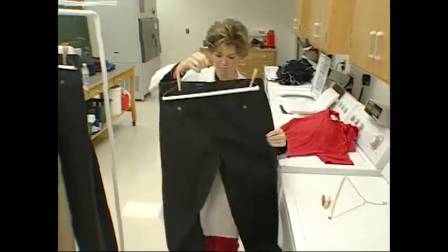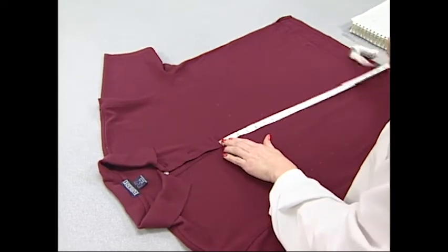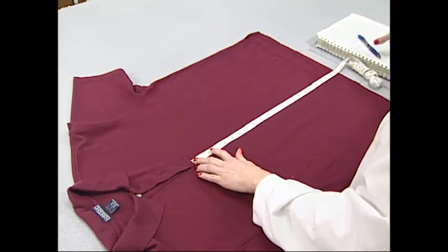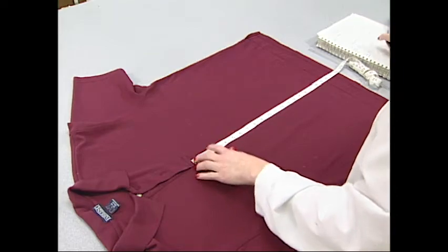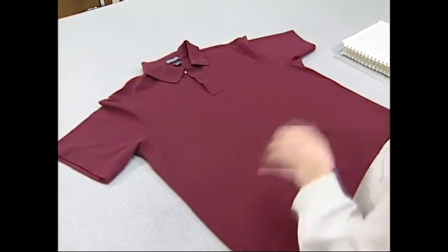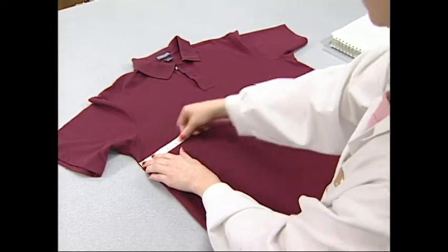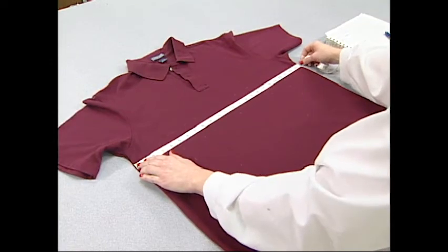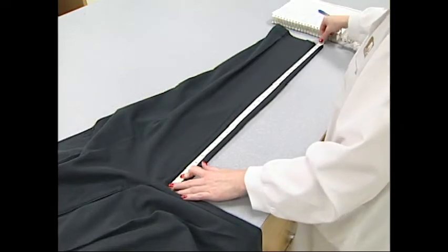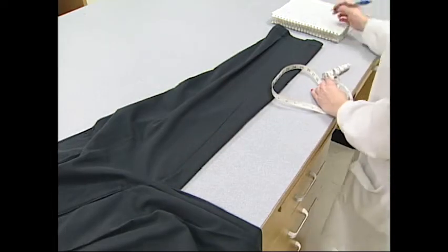After drying, the garments are hung vertically, being careful not to stretch the garment in the length or the width. Each specimen must have its benchmarks measured. In knit constructions, the length is the vertical direction of the garment and is the wale direction. The width is the horizontal direction and the course direction. In woven constructions, the length is called the warp and the width is called the filling. Record the distances as a percentage dimensional change and enter onto a tally sheet or into a spreadsheet.